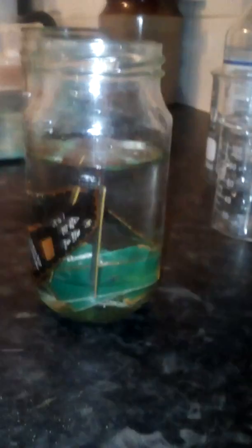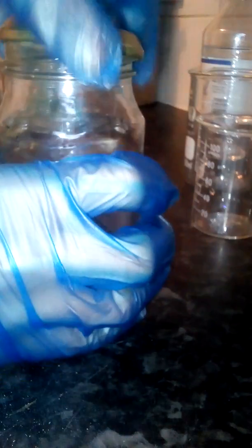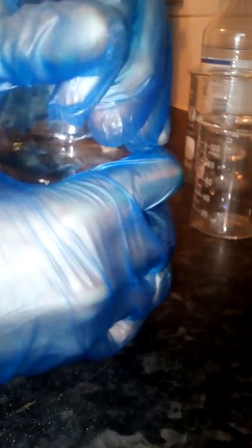Let's get the lid on that. Sometimes you can get quite a bit of gas produced and it'll start bubbling out of the top. Slowly bubbling away, as you can see. Hopefully this won't take so long — sometimes this can take weeks, sometimes it can take days. I suspect this will take days since the boards are quite thin.